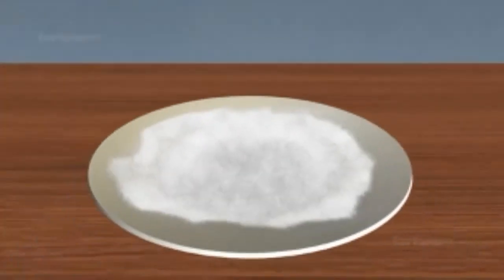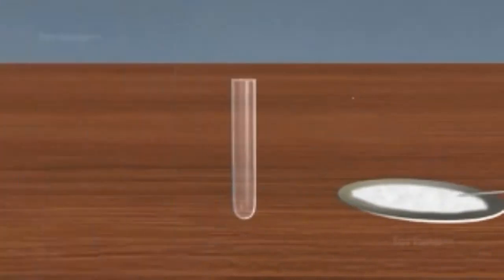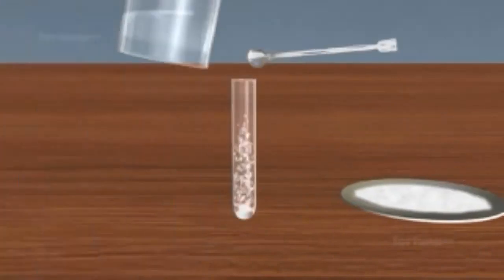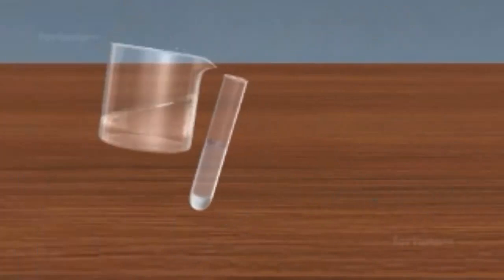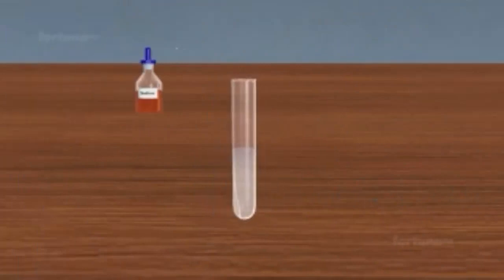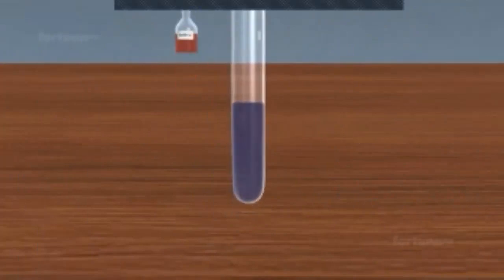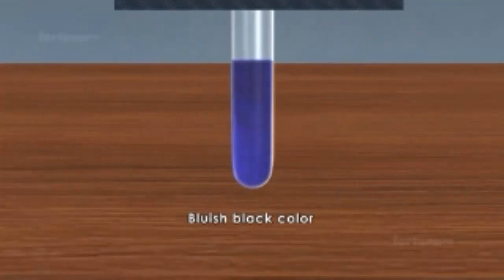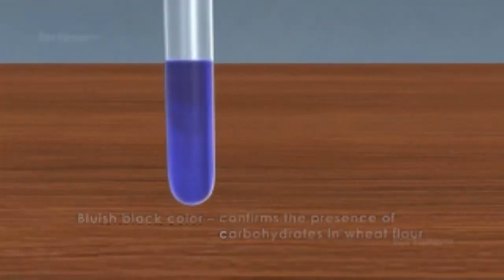Now let's test for the presence of starch in wheat flour. Add a small quantity of wheat flour into a test tube and add water. Shake the solution well so that the flour completely dissolves in the water. Then, using a dropper, add 2 drops of iodine to the flour solution. The solution will turn bluish-black in color, confirming the presence of carbohydrates in wheat flour.